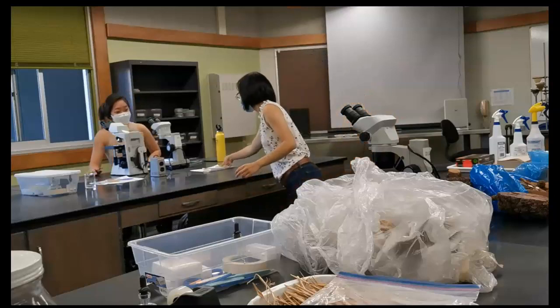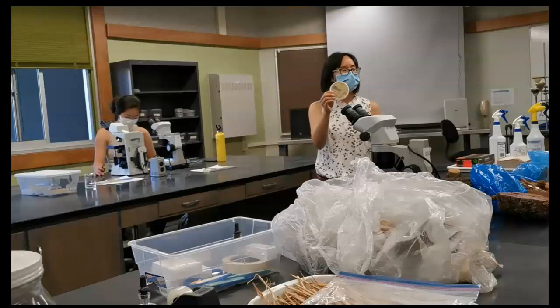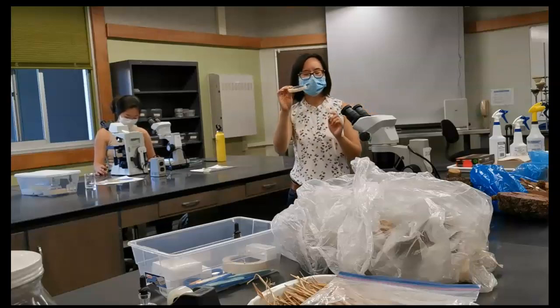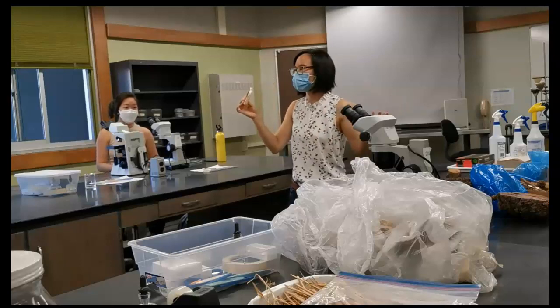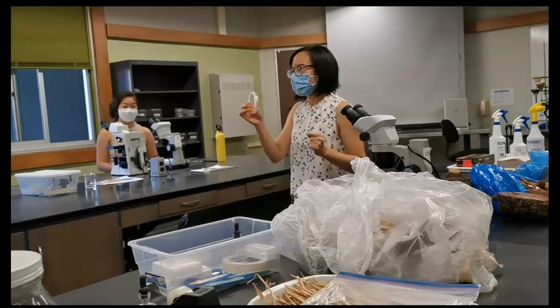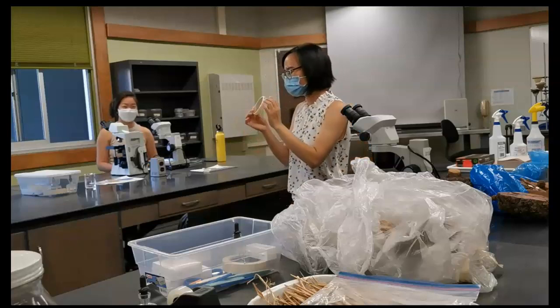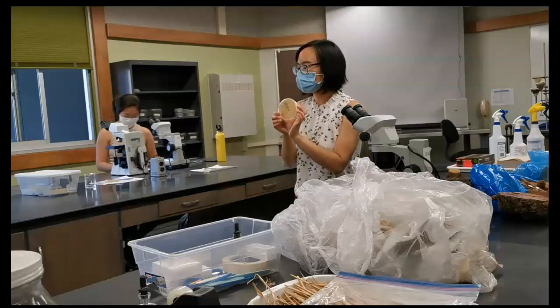And then you also have this one, the bacteria is fire blight. It's bacteria, and if you smell it, well, it's a plant pathogen, so it really doesn't matter if you breathe once, and it smells really bad. And this is bacteria. So for this one, I want you to do three-way streak.